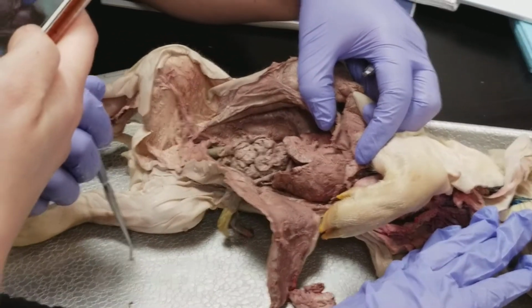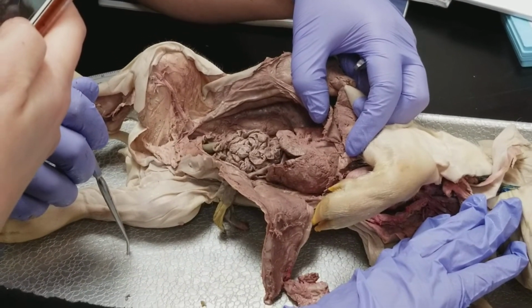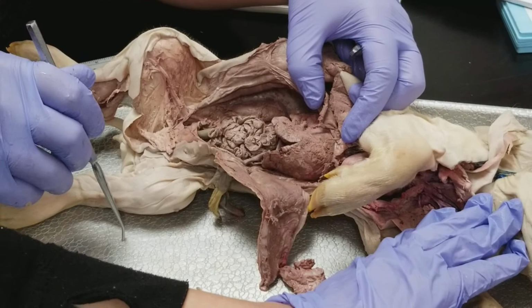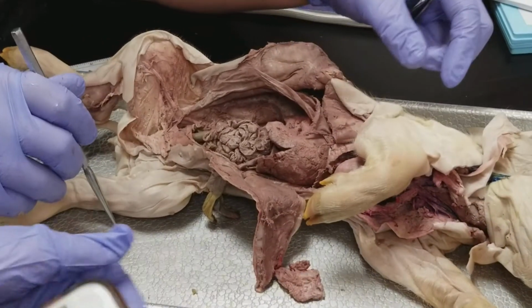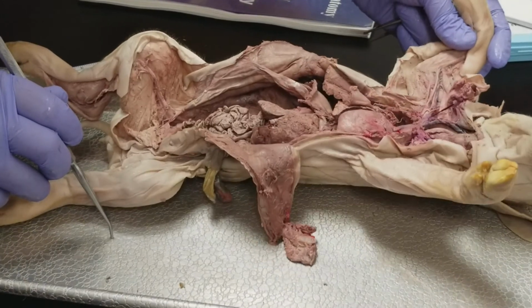I don't think so. That's really everything we can see. We're not going to see the rest of the stuff. I think that was it. Okay. Good then.